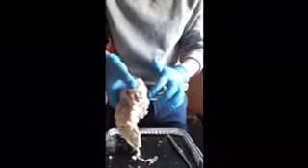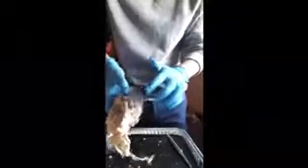the left ventricle. Then we have the right auricle back here, which collects deoxygenated blood and pushes it toward the right ventricle. And then we have the left ventricle down here, which receives blood from the left atrium and pumps it to the aorta. And then we have the right ventricle back here on the opposite side, which receives blood from the right atrium and pumps it to the pulmonary artery.